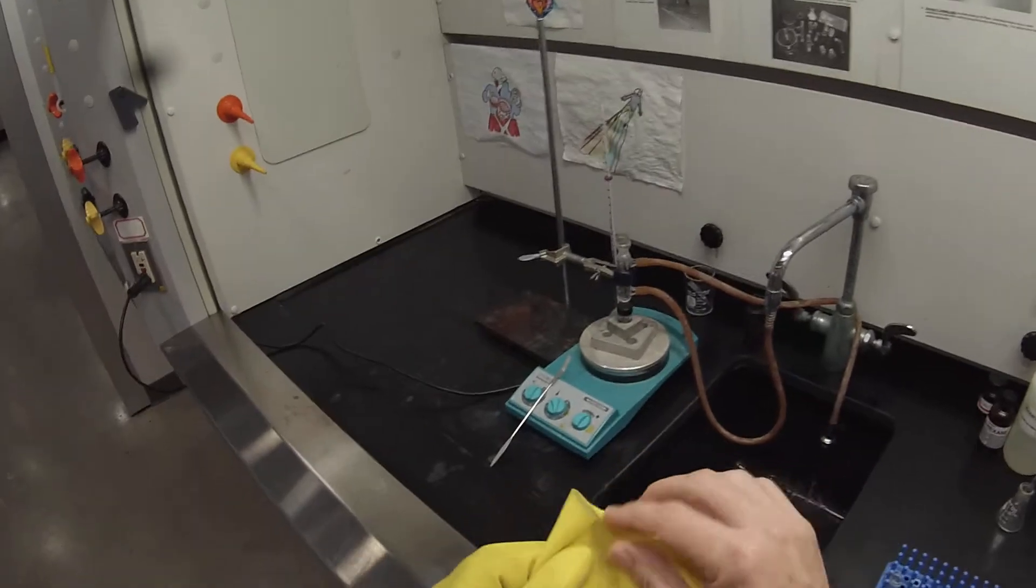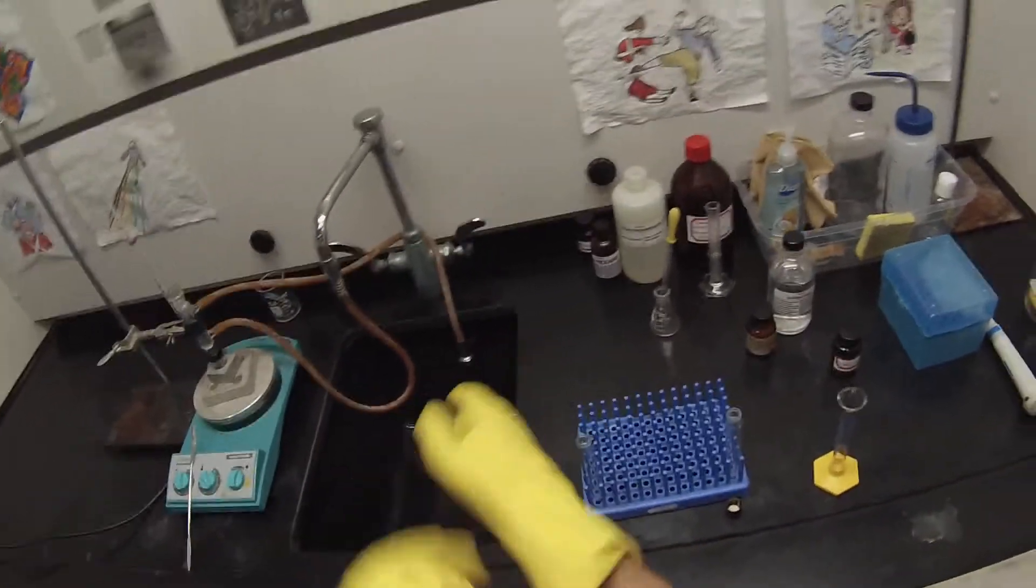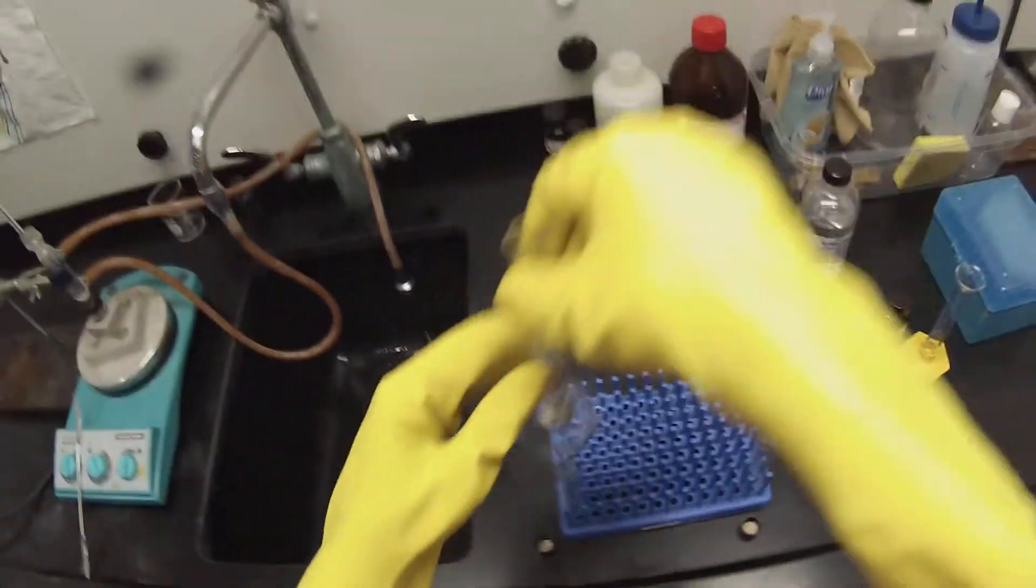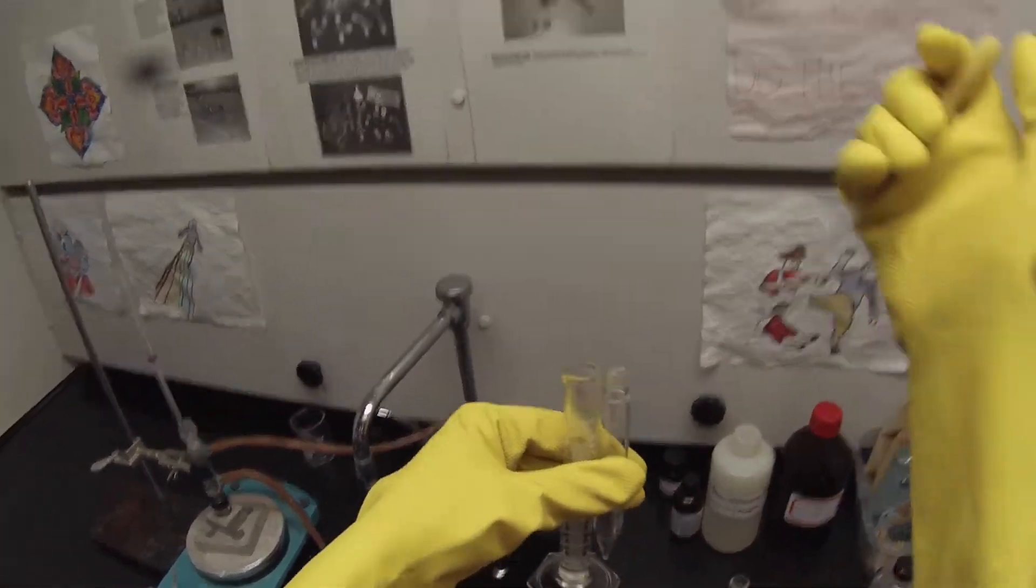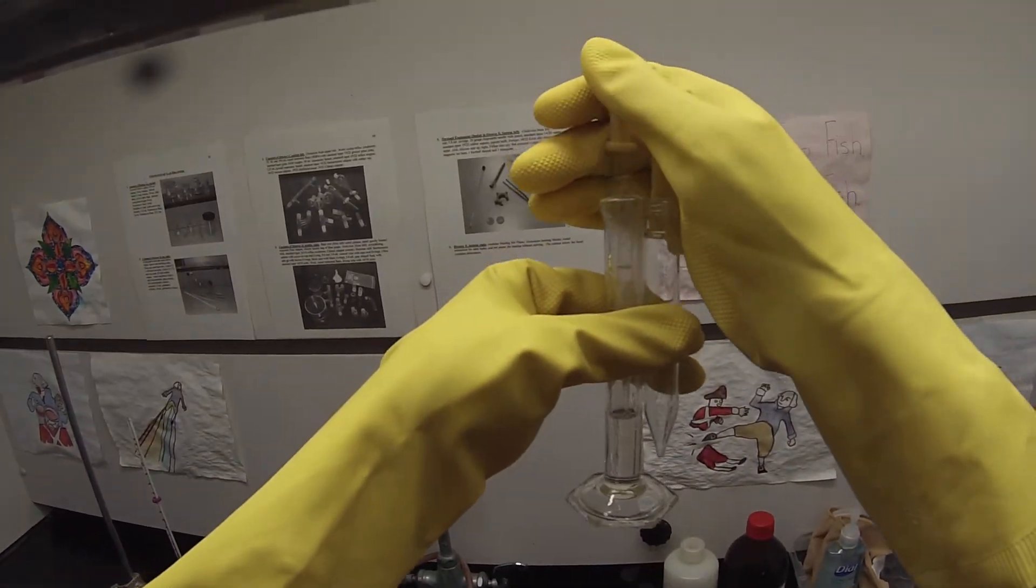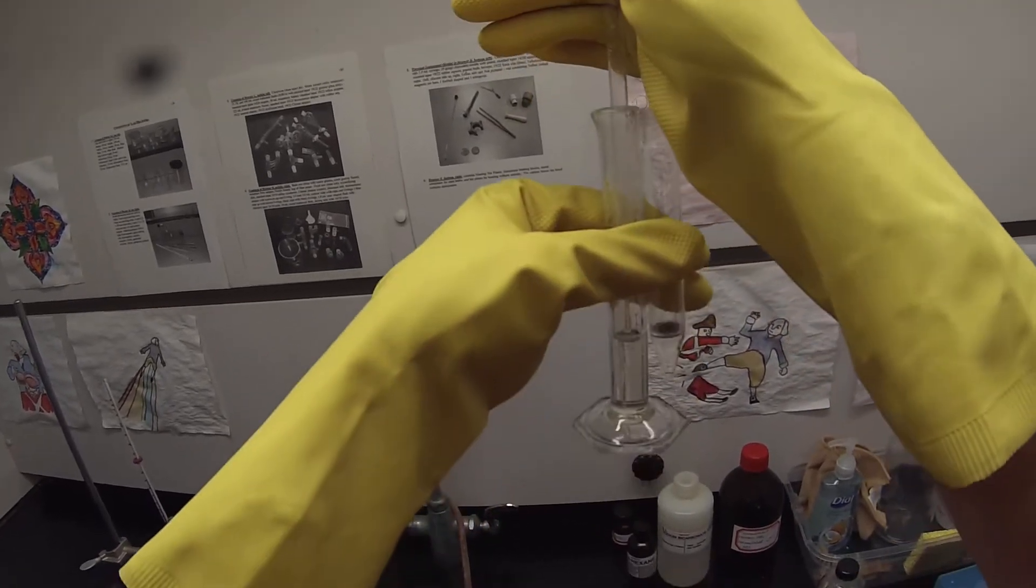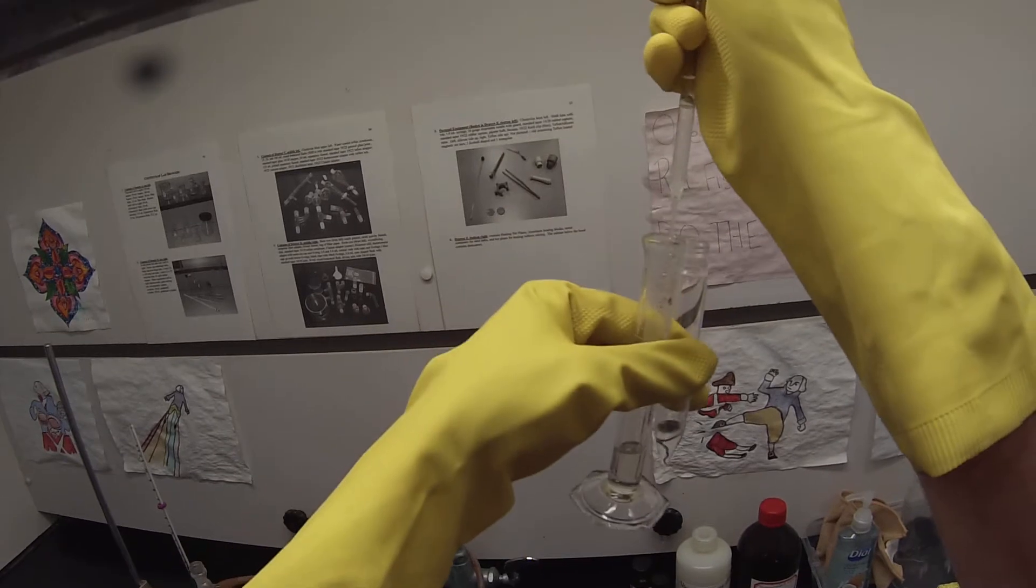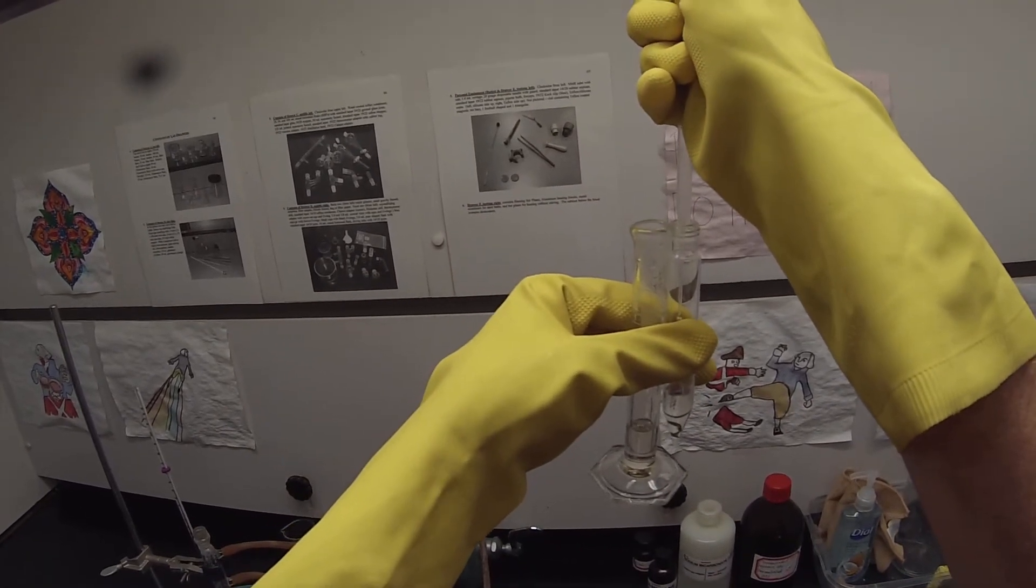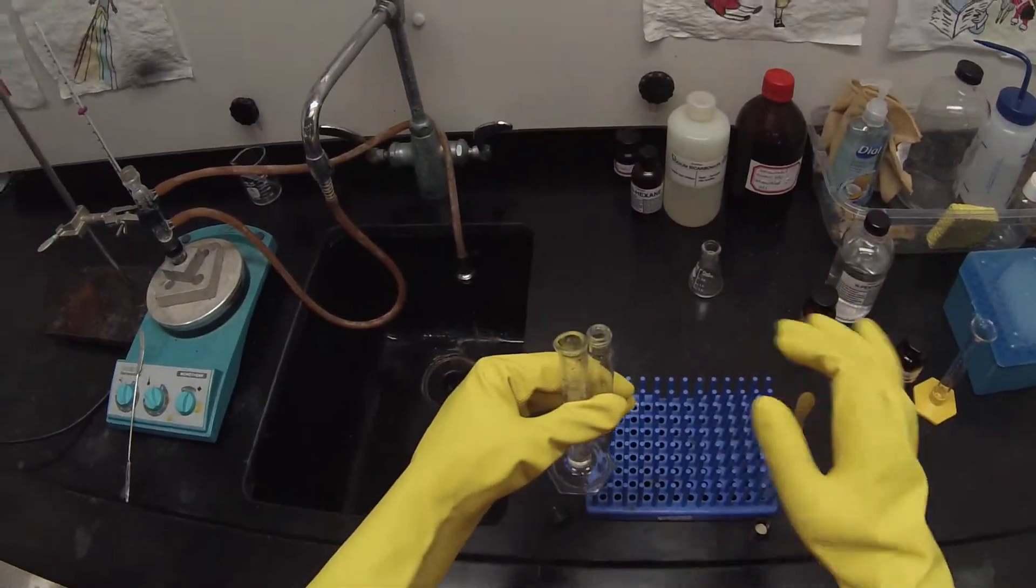The glove is on again so I don't hurt myself. So 4.8 will go down to 2.4 and then the remainder will go into the other tube. That one's ready.